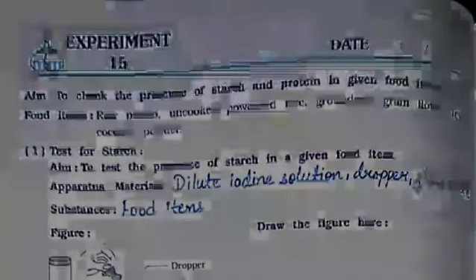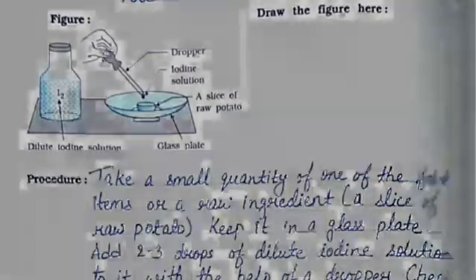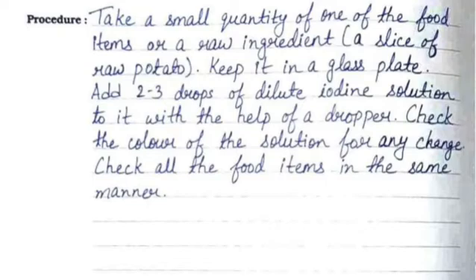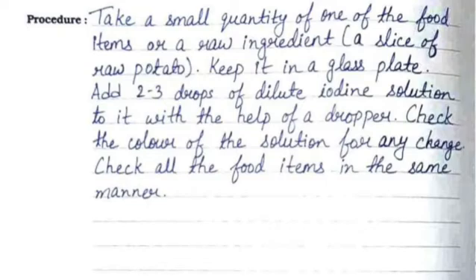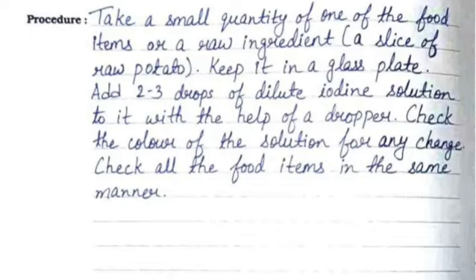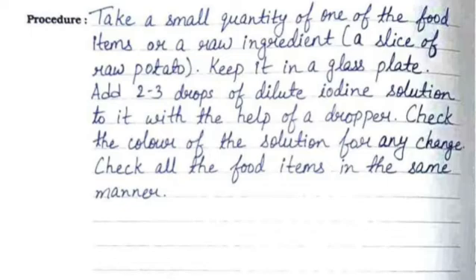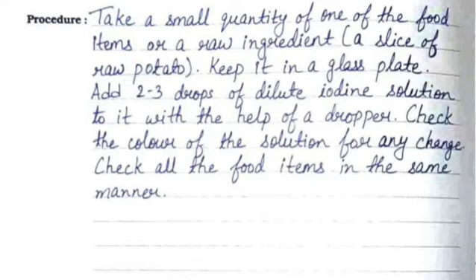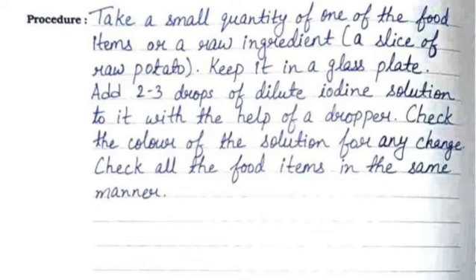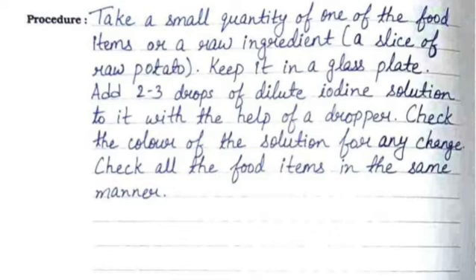You need to draw the same figure on the right-hand side where the space is given. The procedure is: take a small quantity of one of the food items — a slice of raw potato — and keep it on a glass plate. Add two to three drops of dilute iodine solution to it with the help of a dropper. Check the color of the solution for any change, and check all the food items in the same manner.